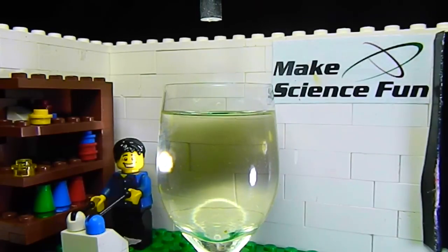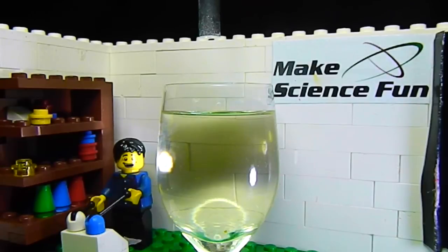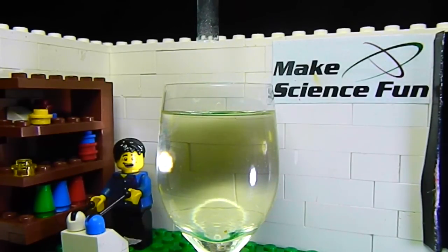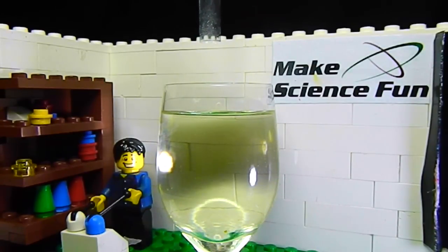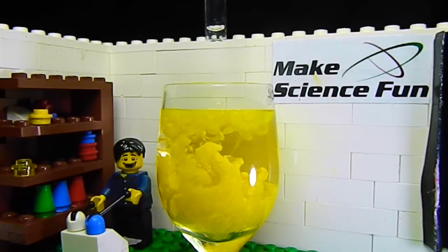G'day! I'm Jacob from Make Science Fun. Today I'm doing the classic lead iodide precipitation reaction. Oh wow!